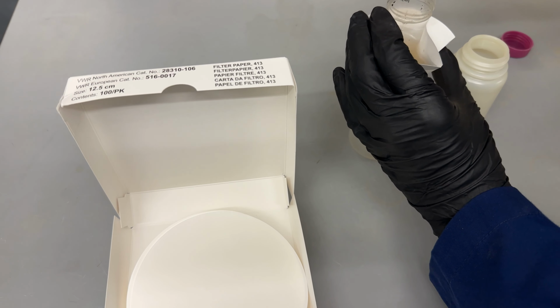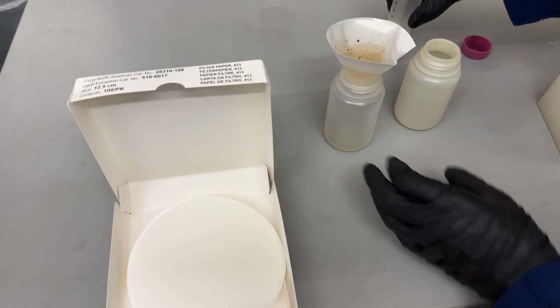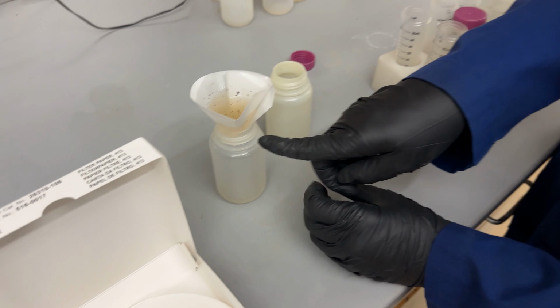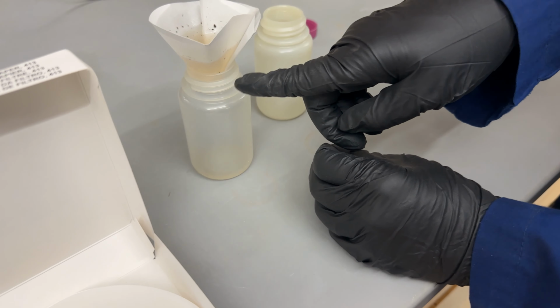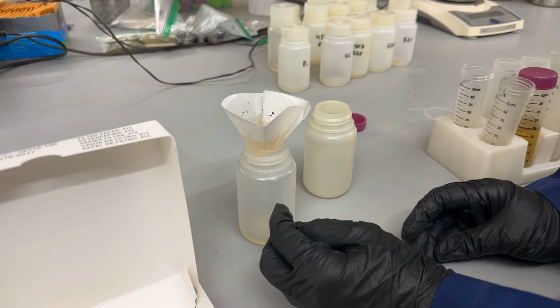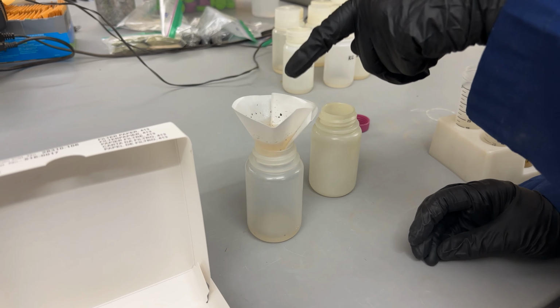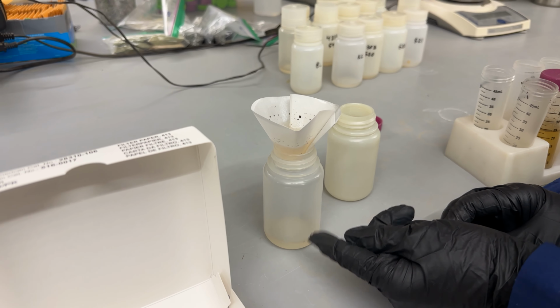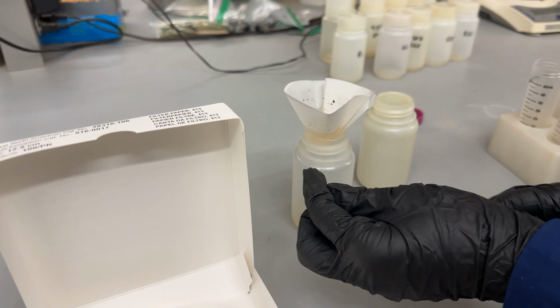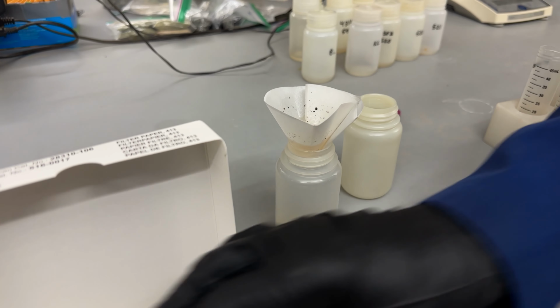And it will have space and it won't overtop the filter. We want to check and make sure that there's gaps between the filter and the edge of the bottle. If there's not a gap there, positive pressure will build up inside the bottle, and instead of water filtering through the filter into the bottle, it will start coming through the pores on the side and overflowing onto the counter. That'll make a big mess, and we don't want that.